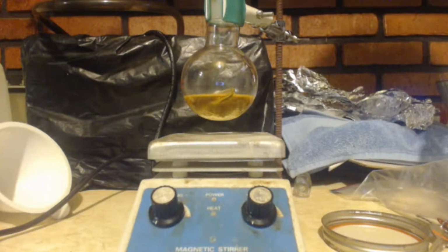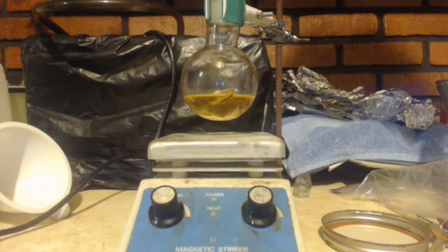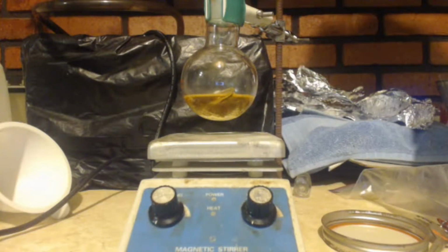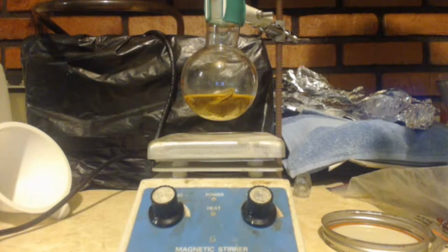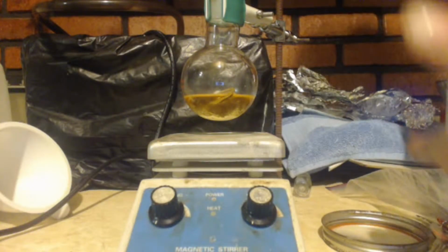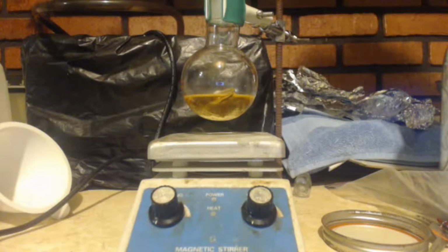Because calcium chloride forms complexes with alcohols, right? And they precip out. Usually, I think it's just for lower alcohols like ethanol and methanol, maybe even isopropanol. But that's like if you're making ether from ethanol, it's good to use calcium chloride. That way, not only do you soak up the water, but you soak up the ethanol that came over during the reaction. You know what I'm saying?